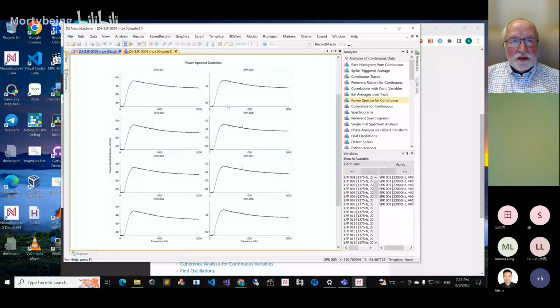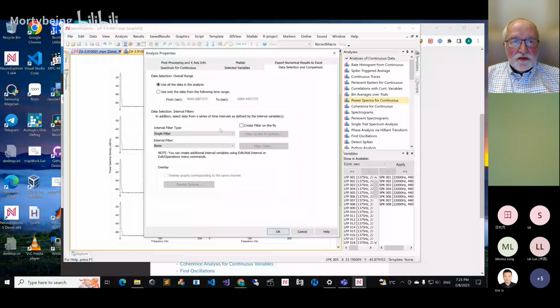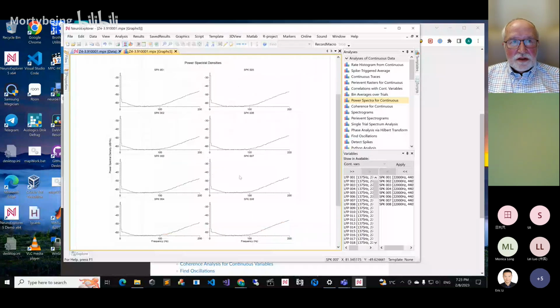Also, let's go back to the first, say, first 200. And here you can also specify whole file or clean. So clean, and go back.